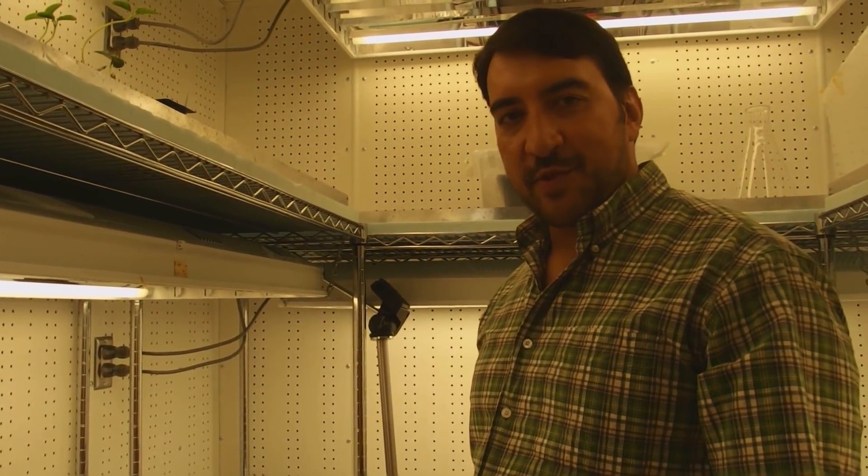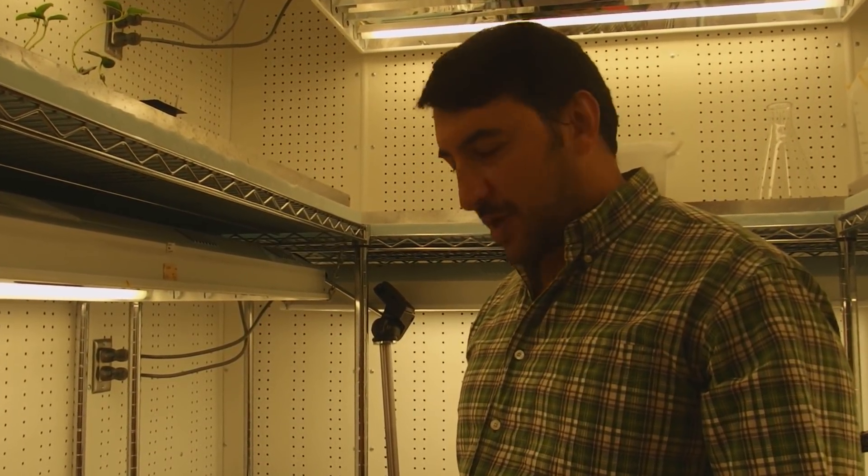All right, I'm going to cut some leaves off of Arabidopsis right here for a genomic DNA extraction. We need genomic DNA to clone some gene promoters from.